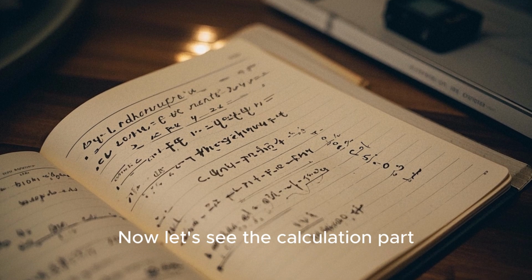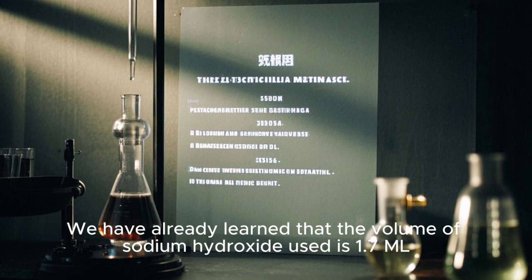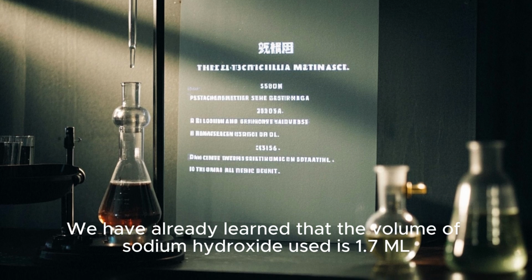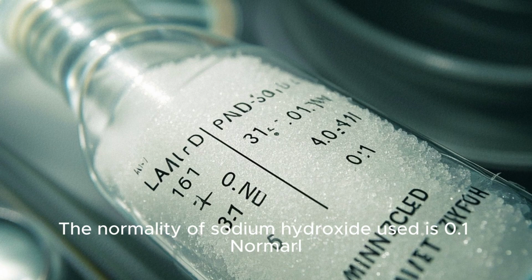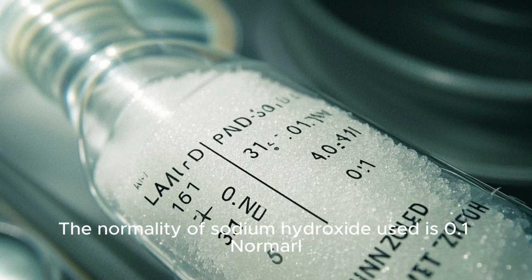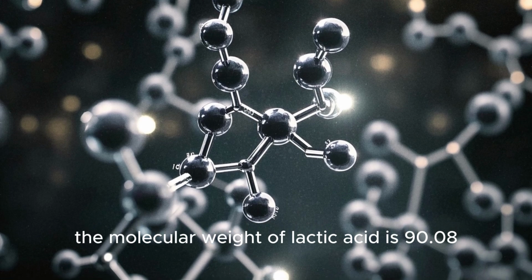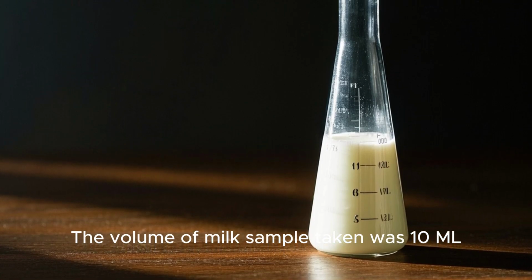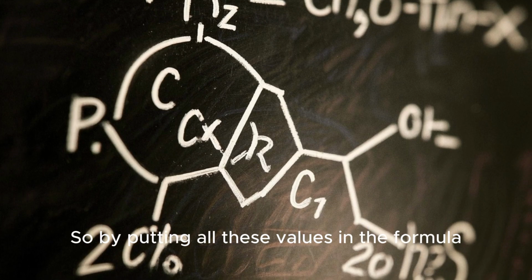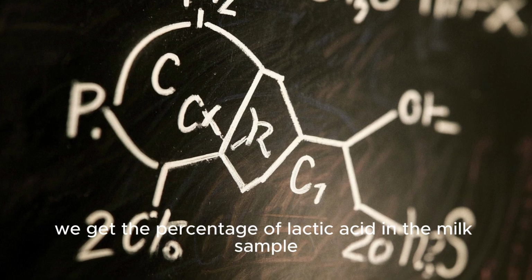Now let's see the calculation part. We have already learned that the volume of sodium hydroxide used is 1.7 ml. The normality of sodium hydroxide used is 0.1 normal. The molecular weight of lactic acid is 90.08. The volume of milk sample taken was 10 ml. So by putting all these values in the formula, we get the percentage of lactic acid in the milk sample.